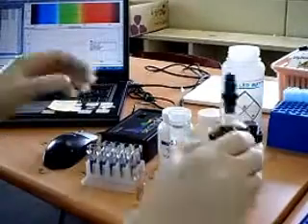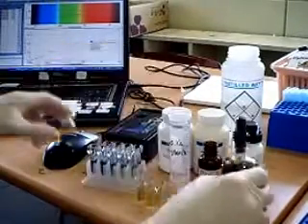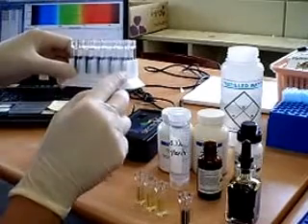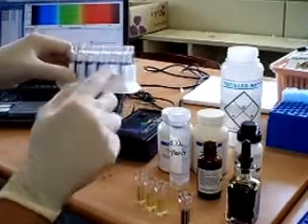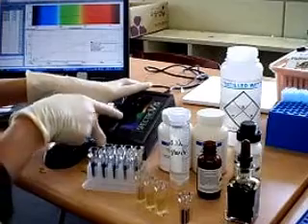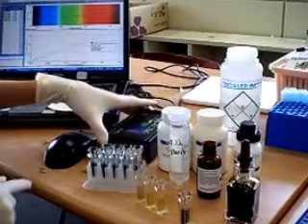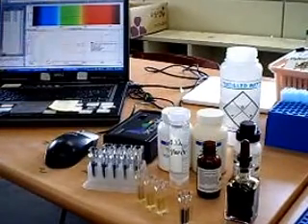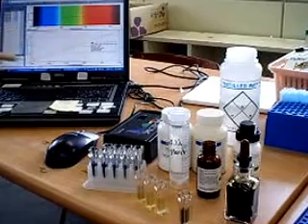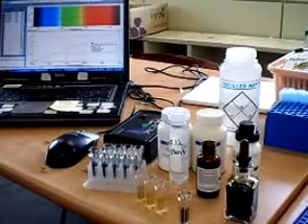From there I'm going to add 10 microlitres of iodine. Starch and iodine will give a blue-black coloration. I'll place it in the cuvette and put it inside the visible spectrophotometer to get my standard calibration curve. So I have my starch standard calibration curve.